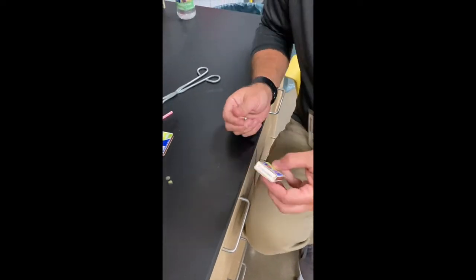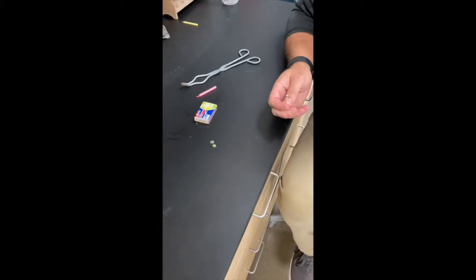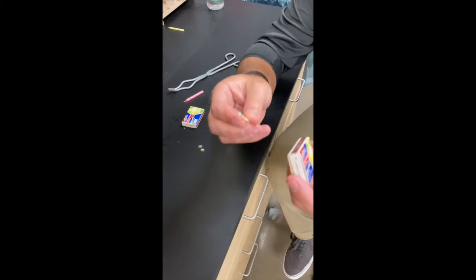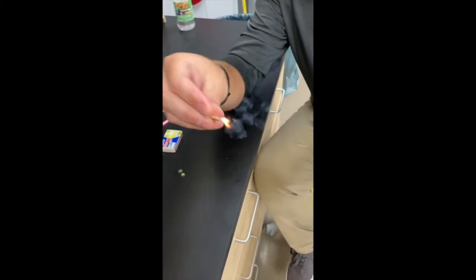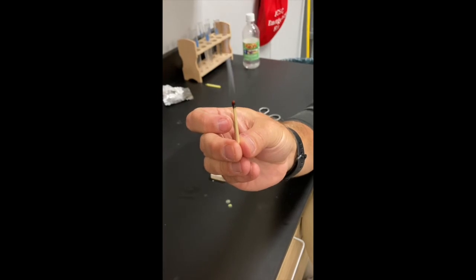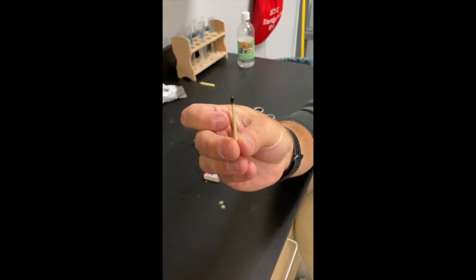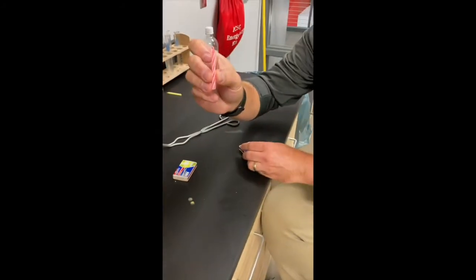So this is the physical chemical change lab. The first of the physical chemical changes is lighting a match. So I'm going to light the match, and you can see it here. And you are to decide if that is a physical change or a chemical change. Obviously, give evidence. Now, step 2 is we're going to light a candle.